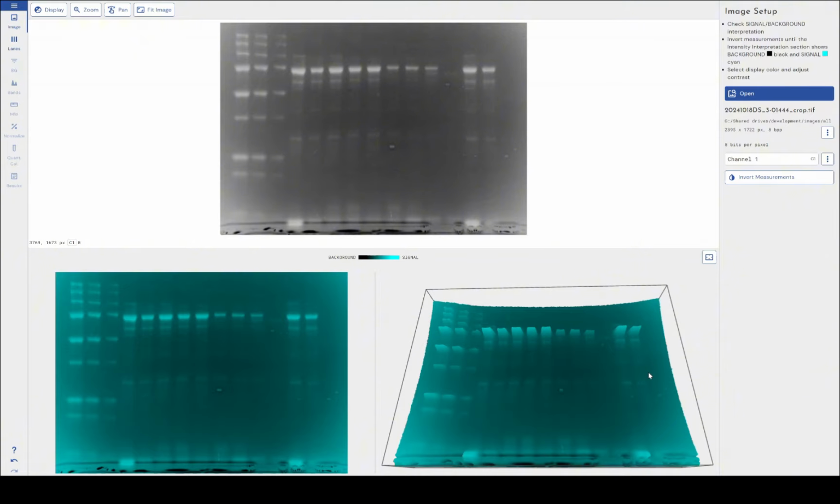The majority of software working in this space to analyze and quantify SDS-PAGE, gel electrophoresis images, and Western blot images only allow you to apply a singular kind of method of background subtraction and a singular strength across your whole image. But there is no one size fits all for an image like this.